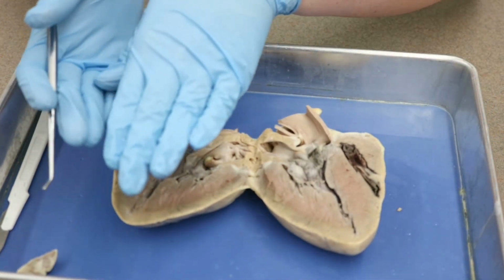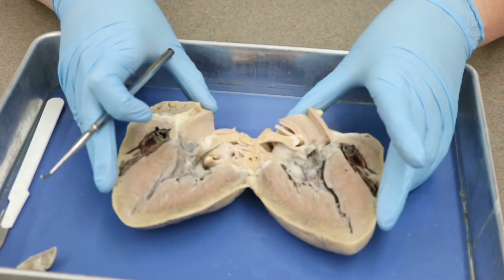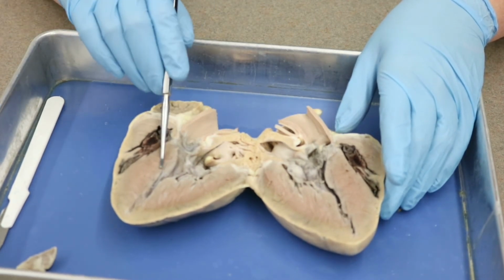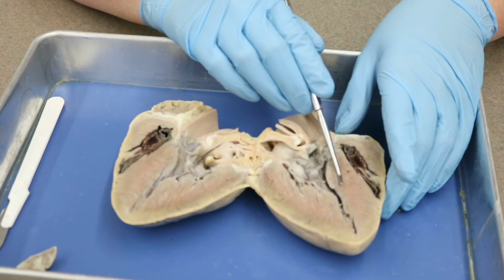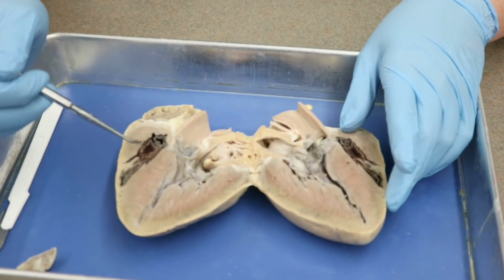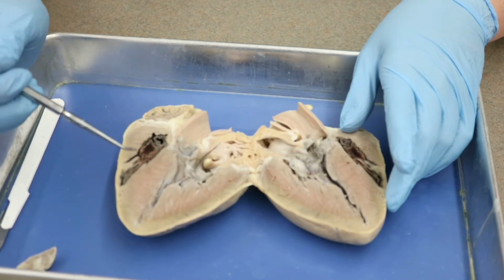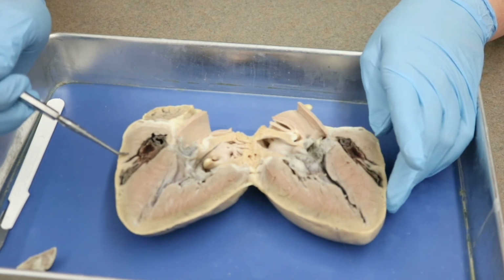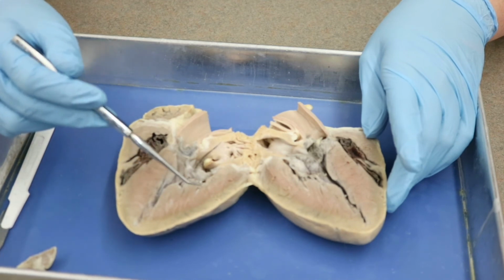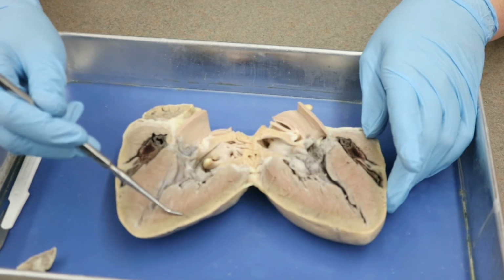It's just instead of me flipping it superiorly, I flipped it laterally. So now we are seeing the two halves of the heart. This is our posterior half, and this is our anterior half. Now, just like we saw before, we have a thicker wall here and a thinner wall. Now, you'll see that this is not as thin as our sheep heart was, but it is definitely still significantly smaller than this one here. So this is still our right side of the heart, and this is our left side of the heart.